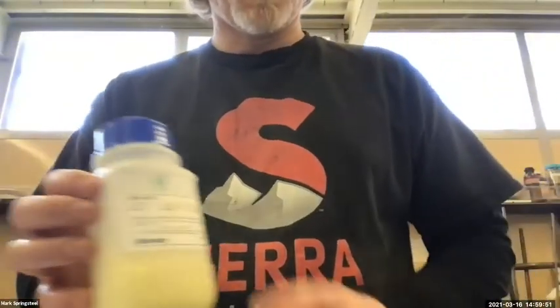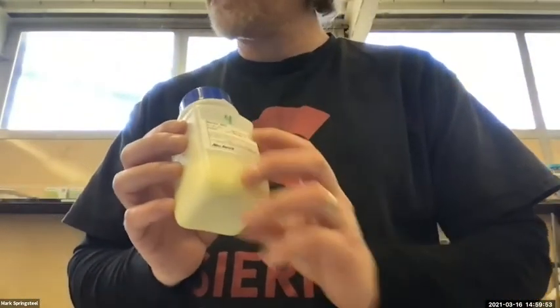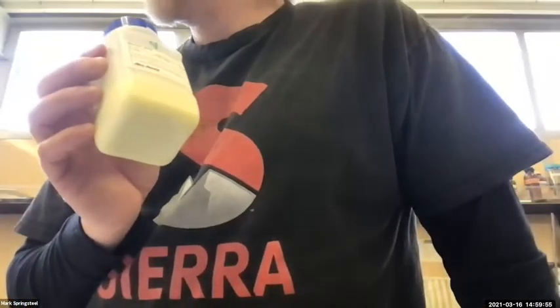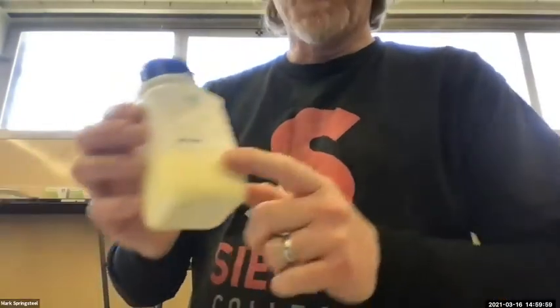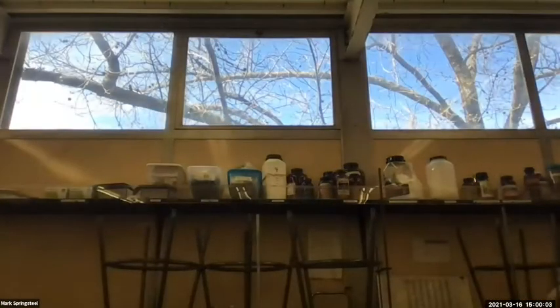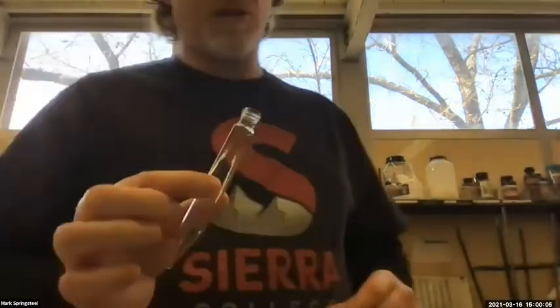So let's go over it, and I'll do what I was saying before. I'm going to weigh out. Oh, actually, before I do that, I'm going to tell you how we're going to do this. We're going to use a certain type of instrument for this. I'm going to be weighing this benzil into a container, though. The container I'm going to use is a centrifuge tube.